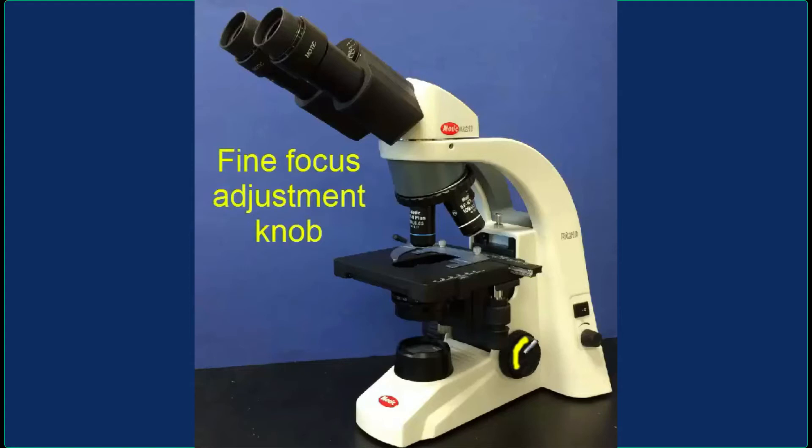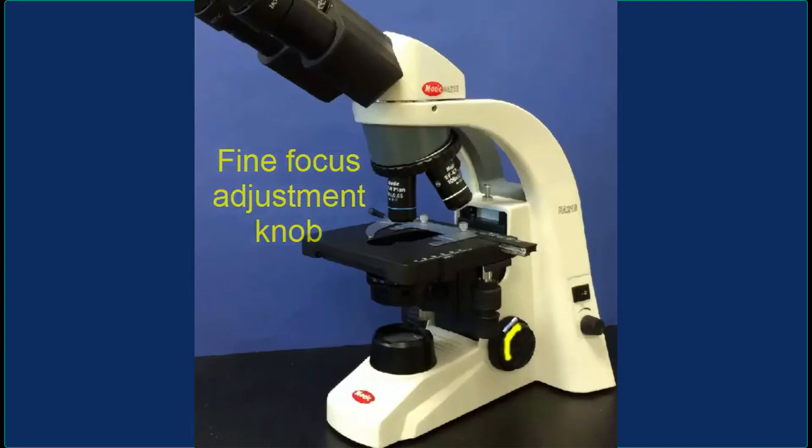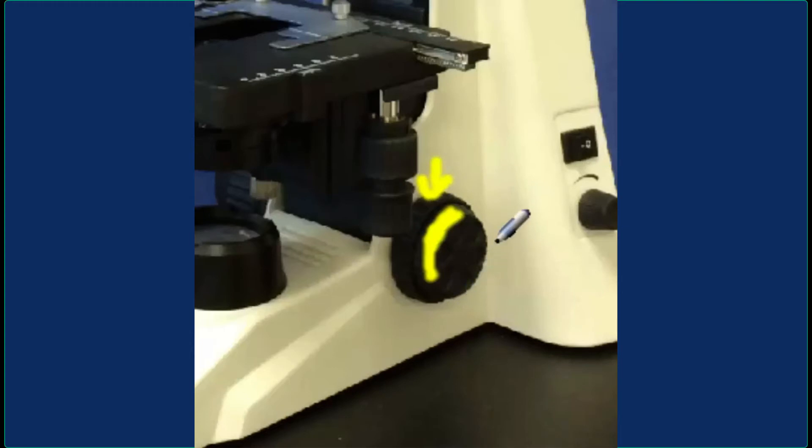To remember the difference: the one closer to the base, which is larger, is the coarse focus adjustment knob. And then you have the fine focus adjustment knob, which is smaller and further from the base.